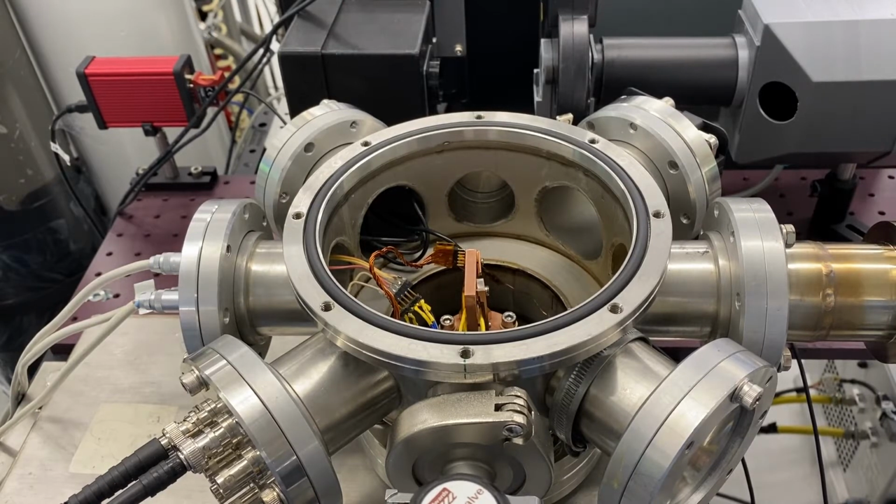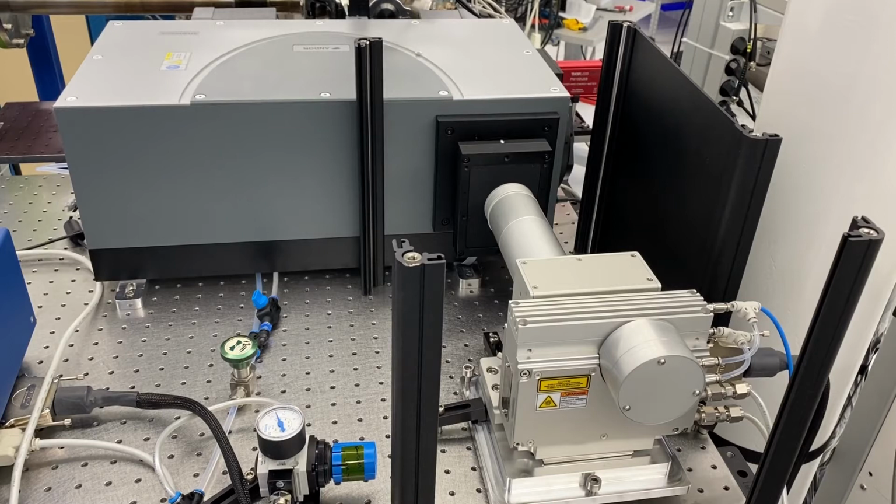Our SSPC setup is located in a vacuum chamber that can be cooled down to 30 Kelvin by a closed-cycle helium refrigerator. The light source is a laser-driven plasma lamp emitting in a broad spectral range between 0.5 electron volts and 6.5 electron volts. The light is sent through a monochromator and then directed onto the sample through a window in the vacuum chamber. We record the diode capacitance with a high precision capacitance meter that simultaneously keeps the diode under a constant reverse bias. The method is capable of resolving defect concentrations on the order of 1% of the free carrier density.